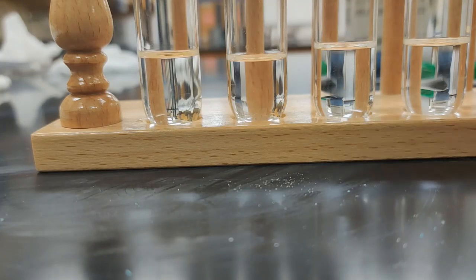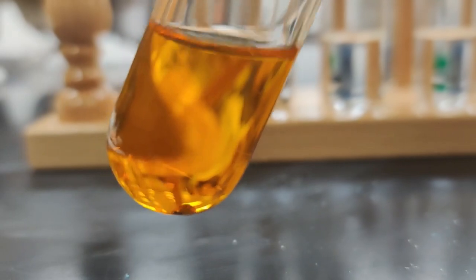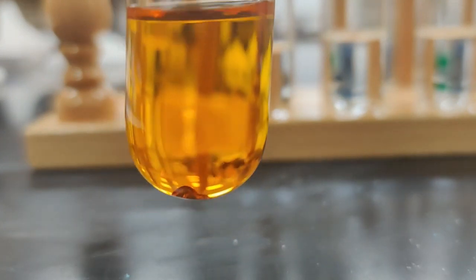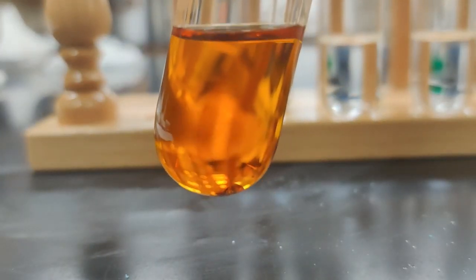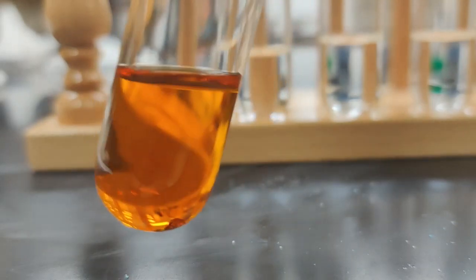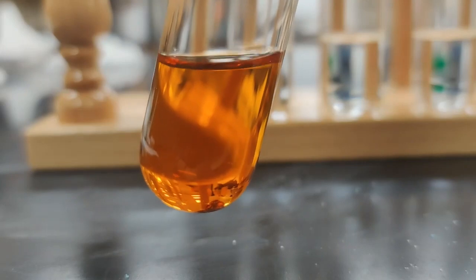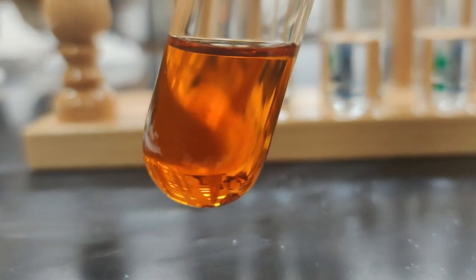Oh wow, and I actually immediately see a difference in the iodine solution. Wow, you can really see that dark brown color that forms. So that clearly tells us that the iodine is soluble. In fact, you can even see that dark color forming at the bottom there, the solution getting darker as the iodine does dissolve. Okay, so clearly iodine is soluble in ethanol. So that's our first result. Iodine does dissolve in ethanol.